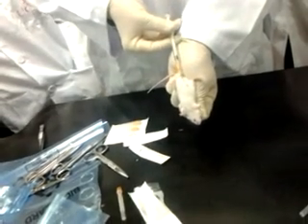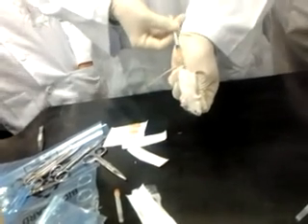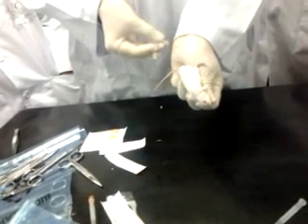This is the linea alba section in the middle part of the abdomen. There's less blood. If you want to use linea alba, you can use it there, less blood. But then I normally use it at the corner here, because most of the intestine, the large cecum, is around here, and we do not want to hit the cecum. When we insert, you can see the limb. At the lower limb here, I position the needle bevel face up.